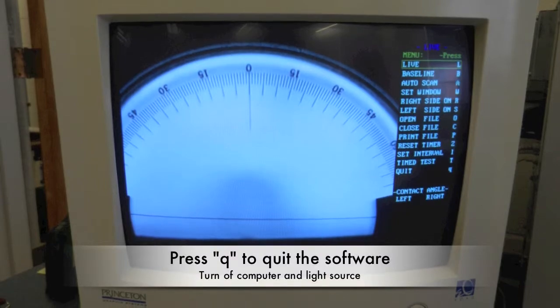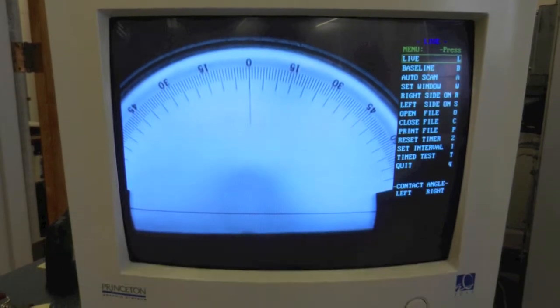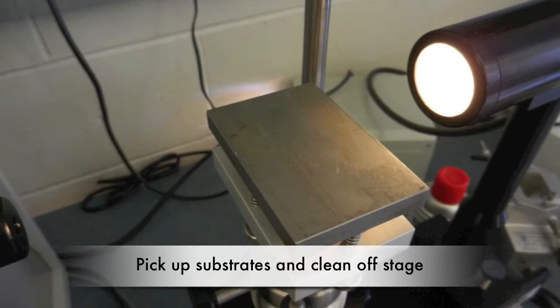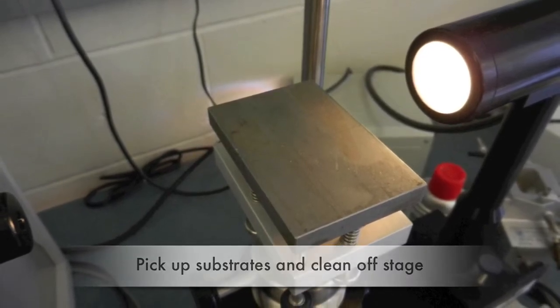When you have completed your experiments, press Q to exit the software. Turn off the computer and the light source. Make sure to pick up your substrates and clean off the stage.